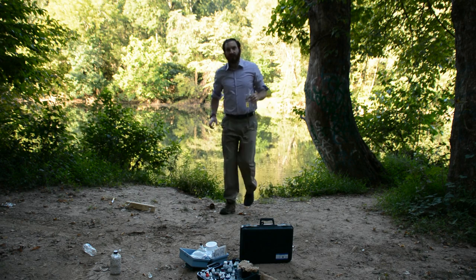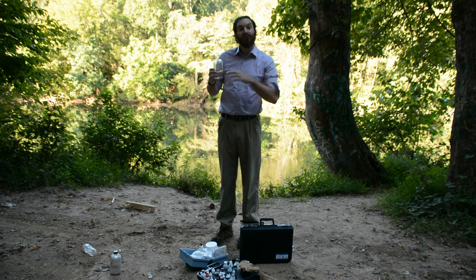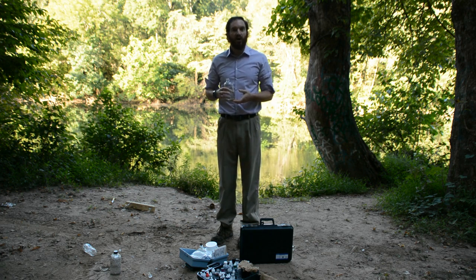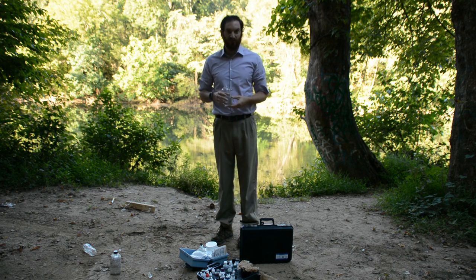So I've got my initial water reading. I tried to be really careful when I was filling this, not to aerate the water too much. All right, and now I'm going to work really quickly because I don't want the temperature to change too fast, so that I can go and get all of the different tests done. First thing I'm going to run is the probe so that I can get that done, and then I can go and do all the chemical testing to this water.